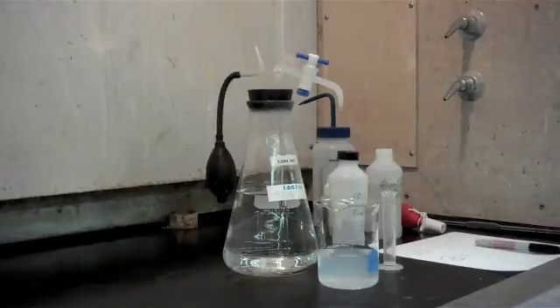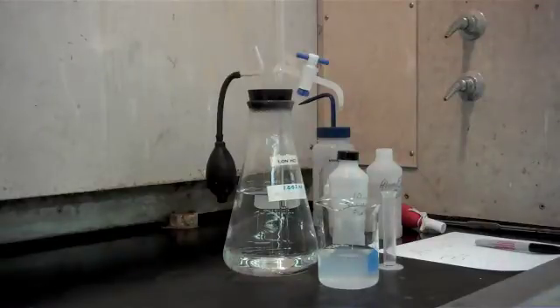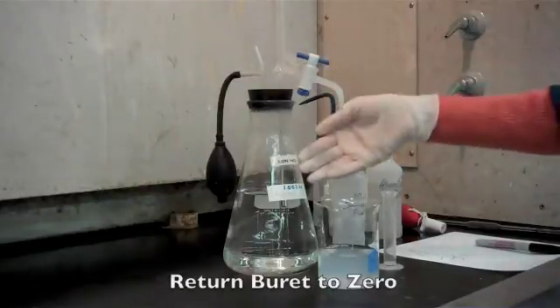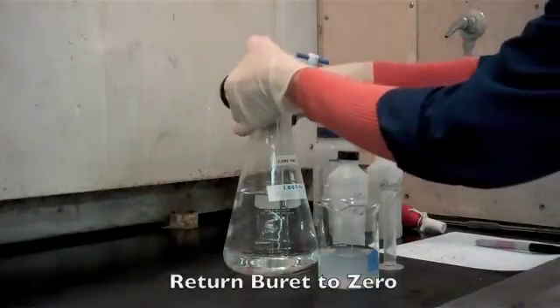First thing we want to do, and it's the most common mistake that people make when they're titrating the second part of this analysis, is they forget to re-zero this burette. So what I'm going to do is refill my hydrochloric acid back to zero.